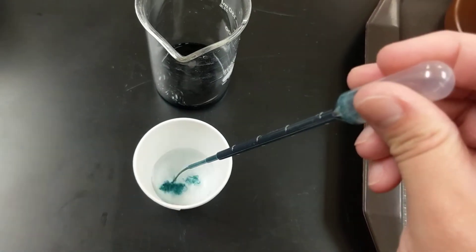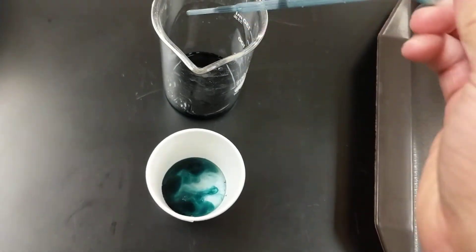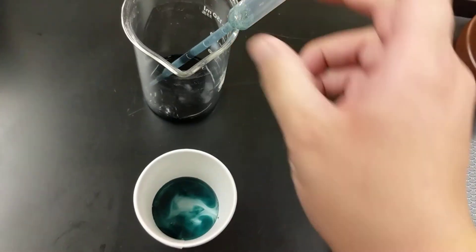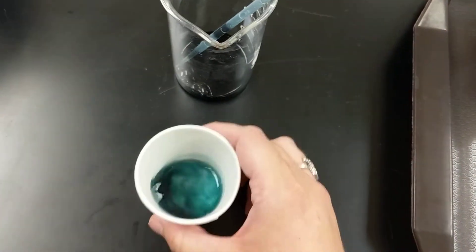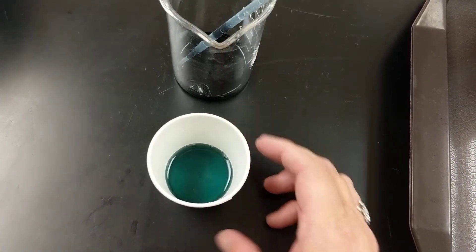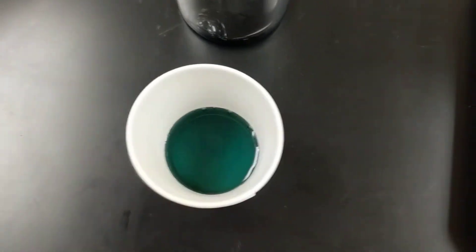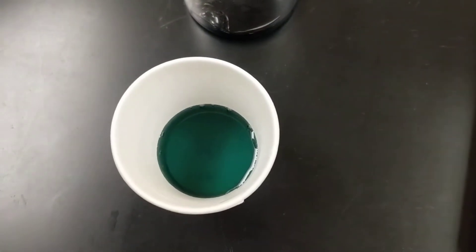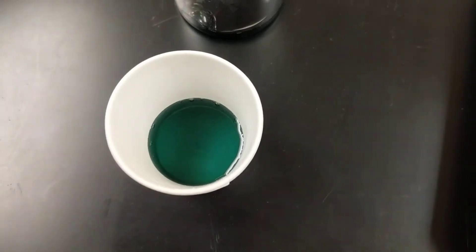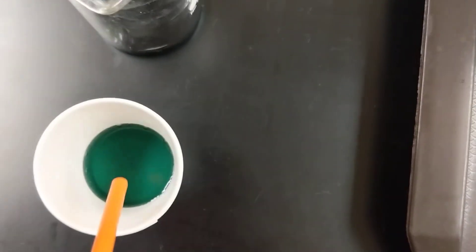I'm going to add some BTB to our water right there, and then I'm going to mix it up a little bit to try to get it evenly distributed. Take note of the color. Now I'm going to take a straw, and I'm going to exhale, and let's see what happens.